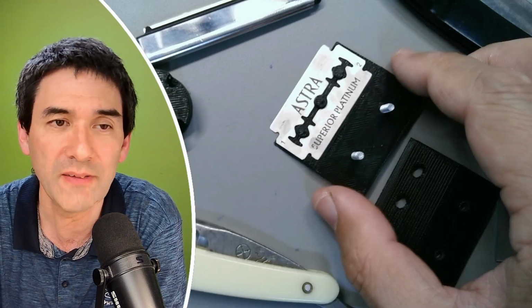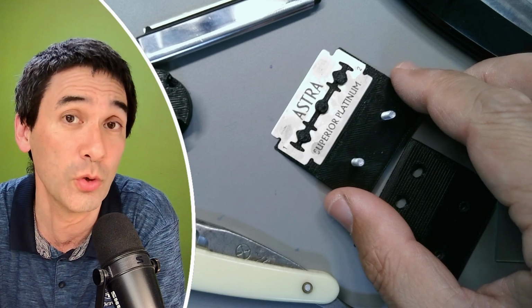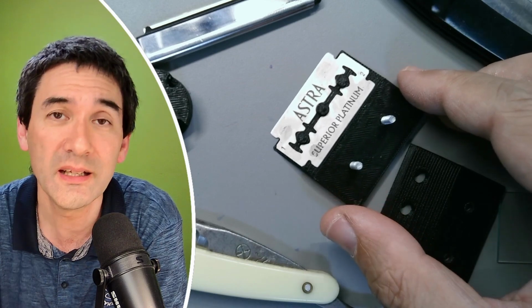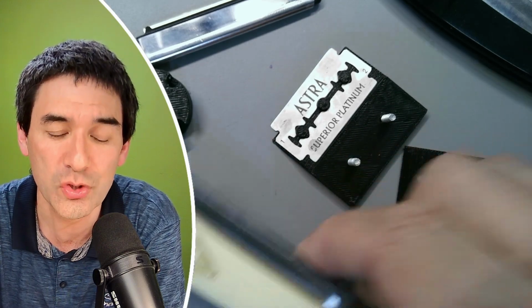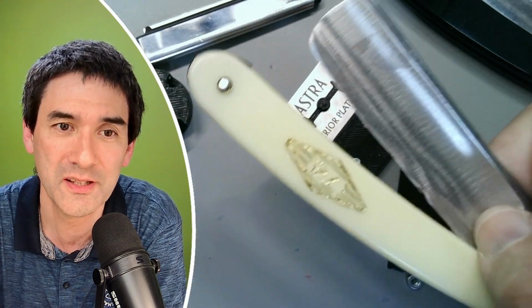My general advice is also that if you want to make good microtome cross-sections, you go by trial and error. What I usually do is I make many cuts, 10, 20, 30 of them, and then I simply choose the best ones, right? And I've not done this now. It was simply a quick demonstration to show you that indeed, this one over here is actually pretty bad.